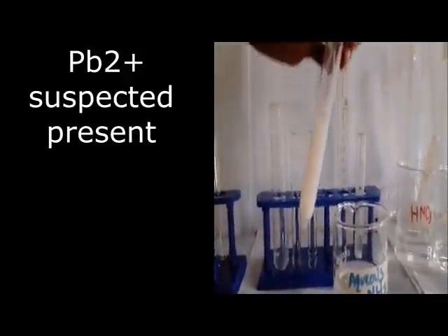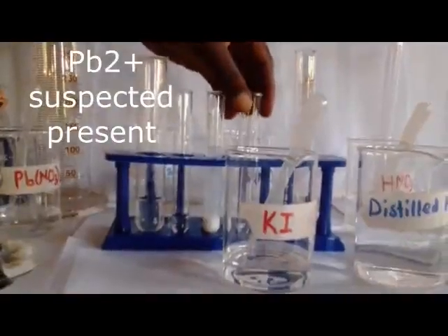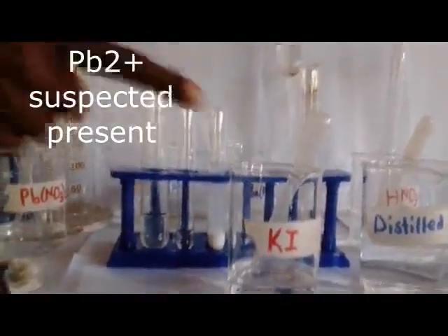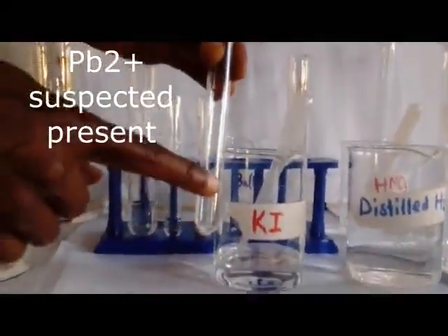Now, after getting that observation, we are going to conclude. But here we are going to insist on lead still. So we shall say lead 2 ions.